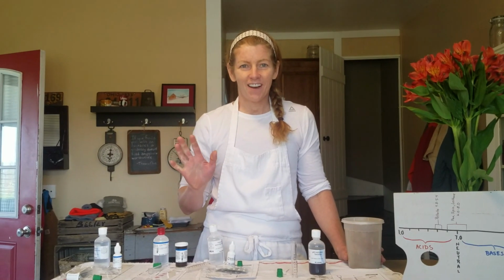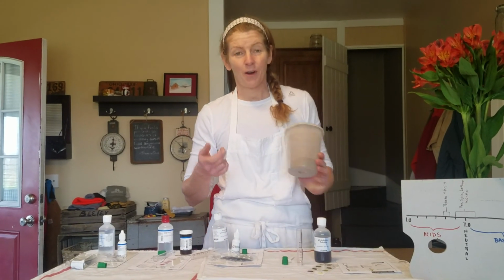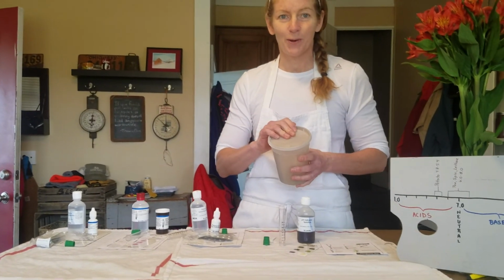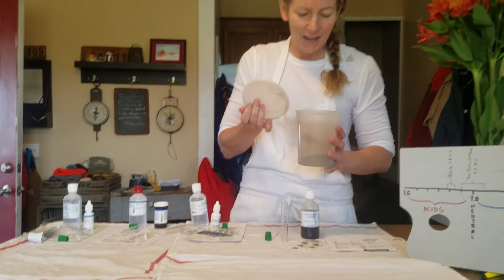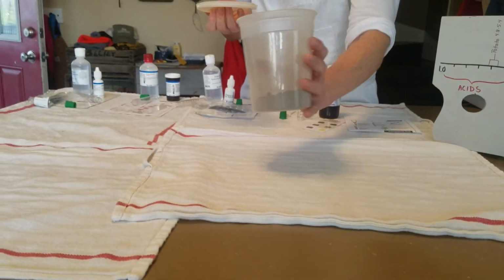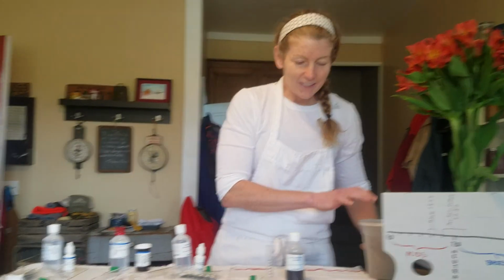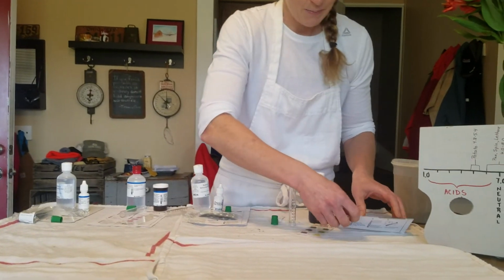Hi students, today what we're going to do is a soil test. If you recall, last week I collected a sample of soil from the garden bed where we're going to be growing the potatoes, and this is what the soil looks like now. It's really dried out, and Aubrey and I have been crushing it to get it all nice and powdered up. So it's ready to test, and what we're going to test for today is pH.